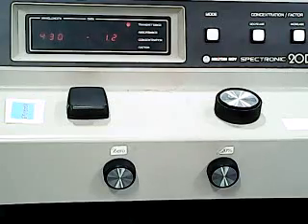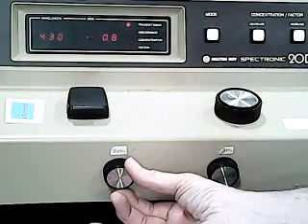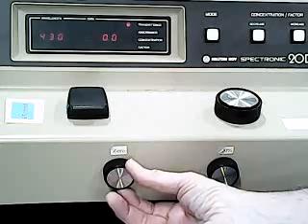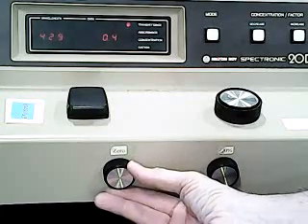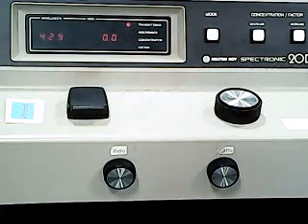In order to use the instrument, we have to make several adjustments. The first obvious one we've already made is we set it to the wavelength we want, 430. Next, we have to tell the sensor what to be expecting. And the first step in doing that is we have to adjust the 0 adjust knob so that the reading is 0. This takes into account any stray light that might just happen to be inside the instrument affecting the sensor. We're telling it to ignore that stray light.